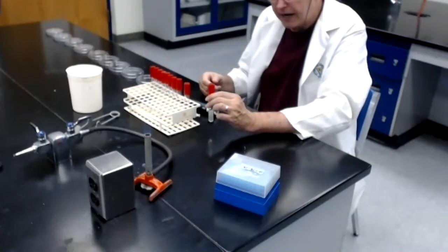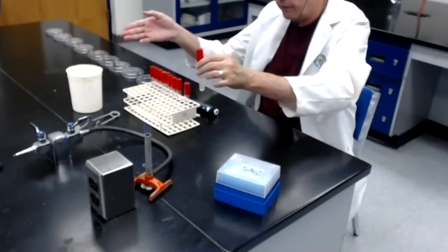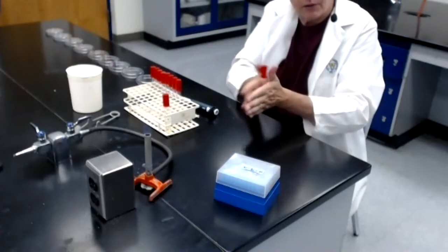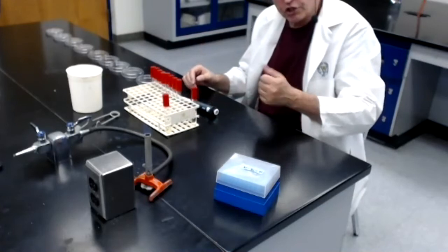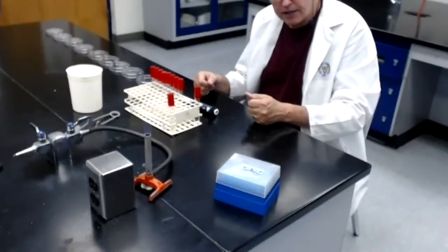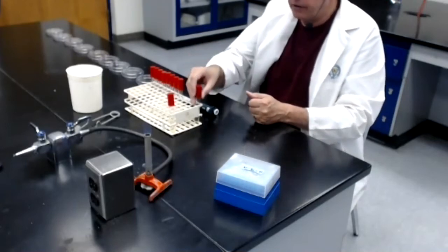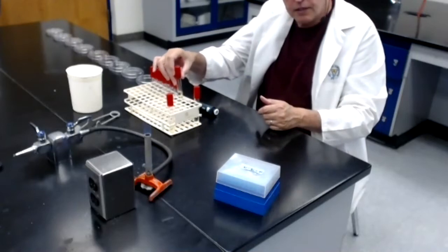So at this point, I have prepared 2 dilutions. Tube number 1, which is a 1/10 dilution of the milk, and tube number 2, which is a 100th dilution of the milk. Let me do one more just so I'm sure you get the drift. So now I want to prepare dilution tube number 3, which is labeled 1,000th. The way I'm going to prepare a 1,000th dilution is by taking 1 mil from the 100th dilution that I just did and putting it into the 9 mils in dilution tube number 3.